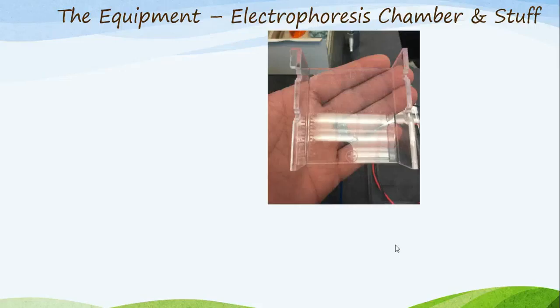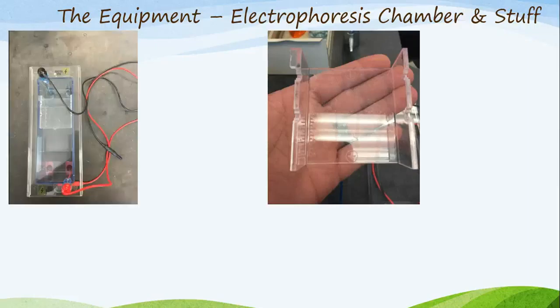Now we'll move on to the other pieces of equipment, largely known as the electrophoresis chamber and the other stuff that goes along with it. So let's familiarize ourselves with some of the stuff. This apparatus as a whole is the electrophoresis chamber. You will notice it has several parts to it. The first, it has a lid. That lid is securely placed on top by the electrodes.